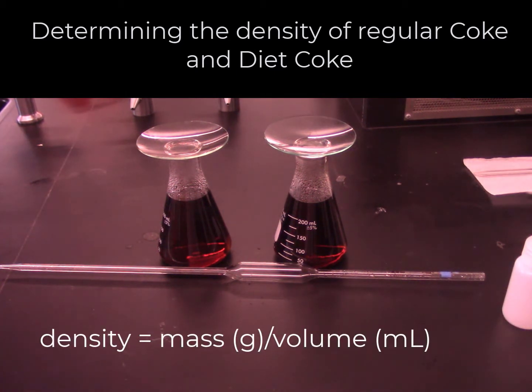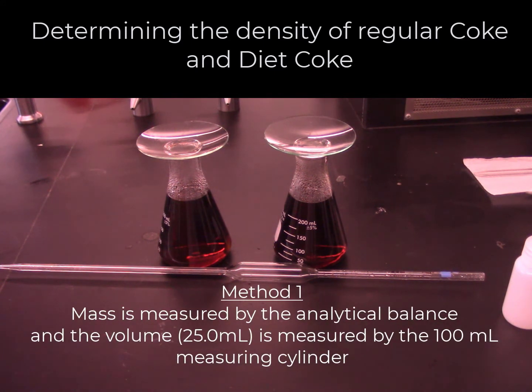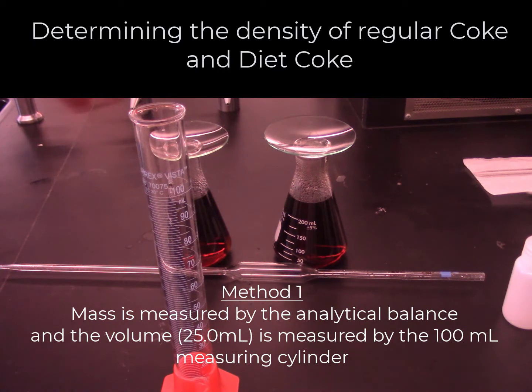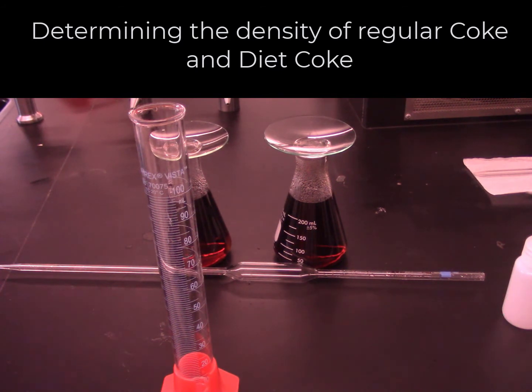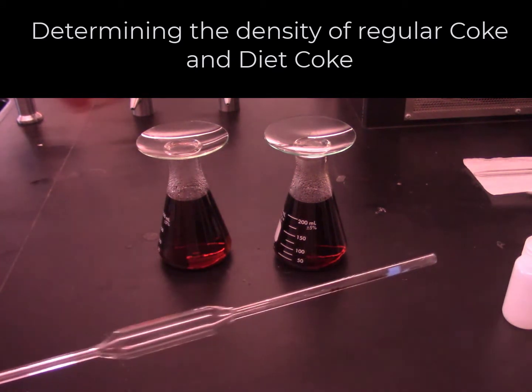You know that density is mass per unit volume. I will use 25 milliliters of each solution and measure its mass using an analytical balance. I will measure the volumes using two different methods. In method 1, I will measure the volumes of each sample using a 100 milliliter measuring cylinder. Remember, we can measure the volume to 1/10 of a milliliter using this measuring cylinder. In method 2, I will measure the volumes using a 25 milliliter volumetric pipette.